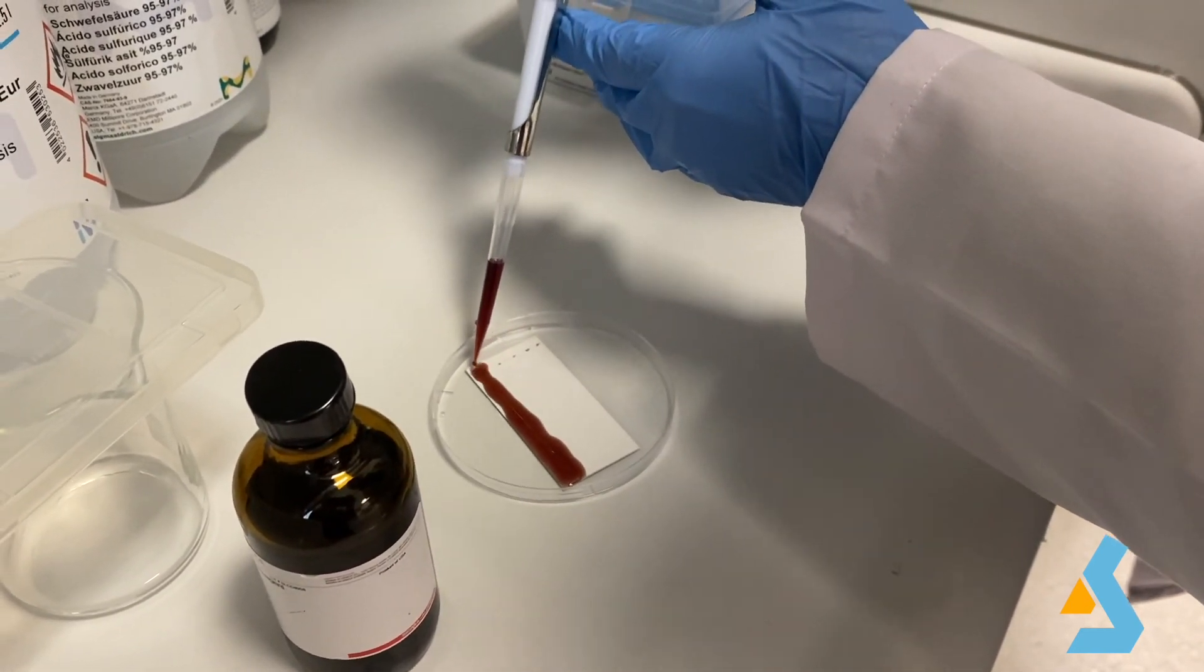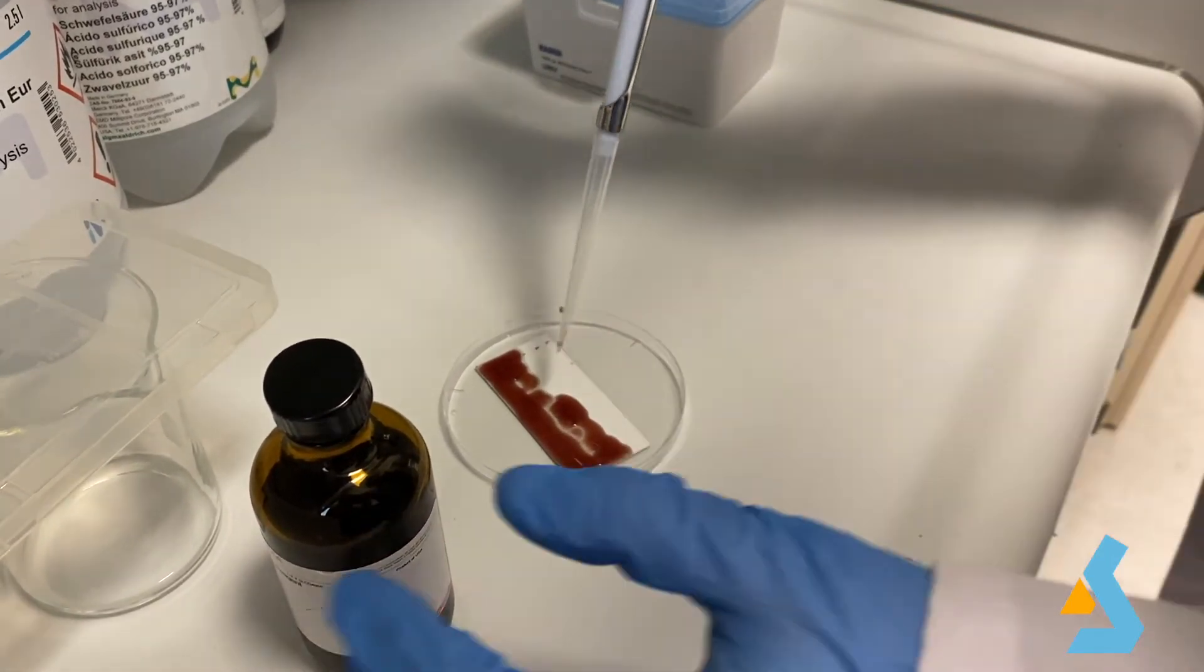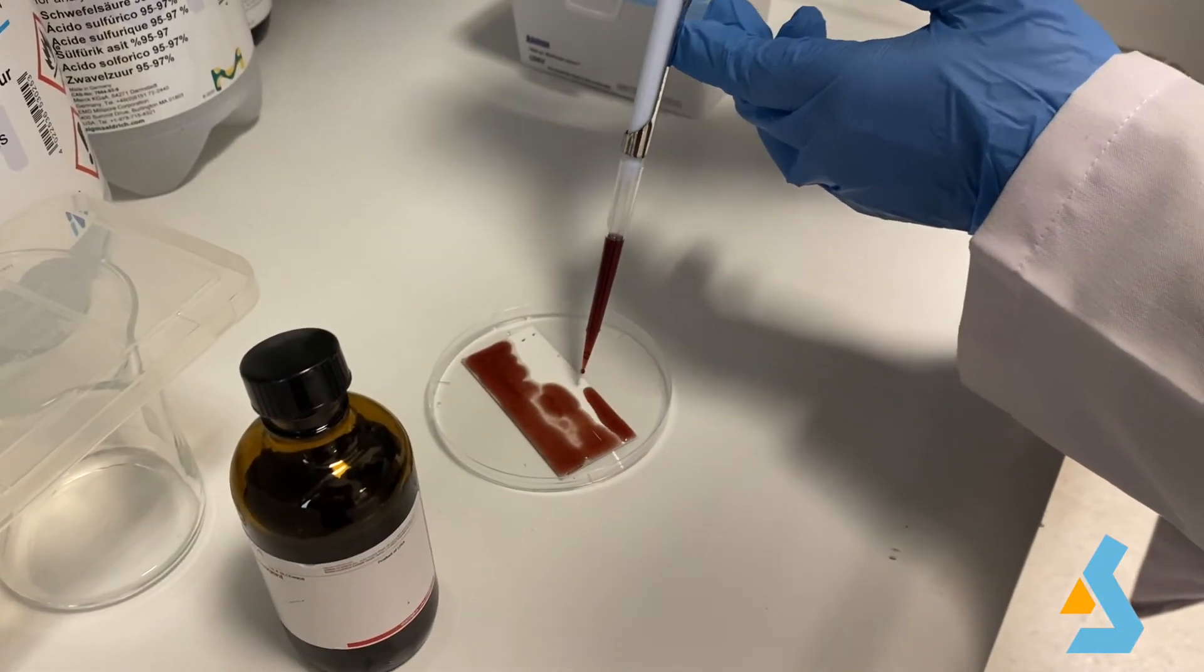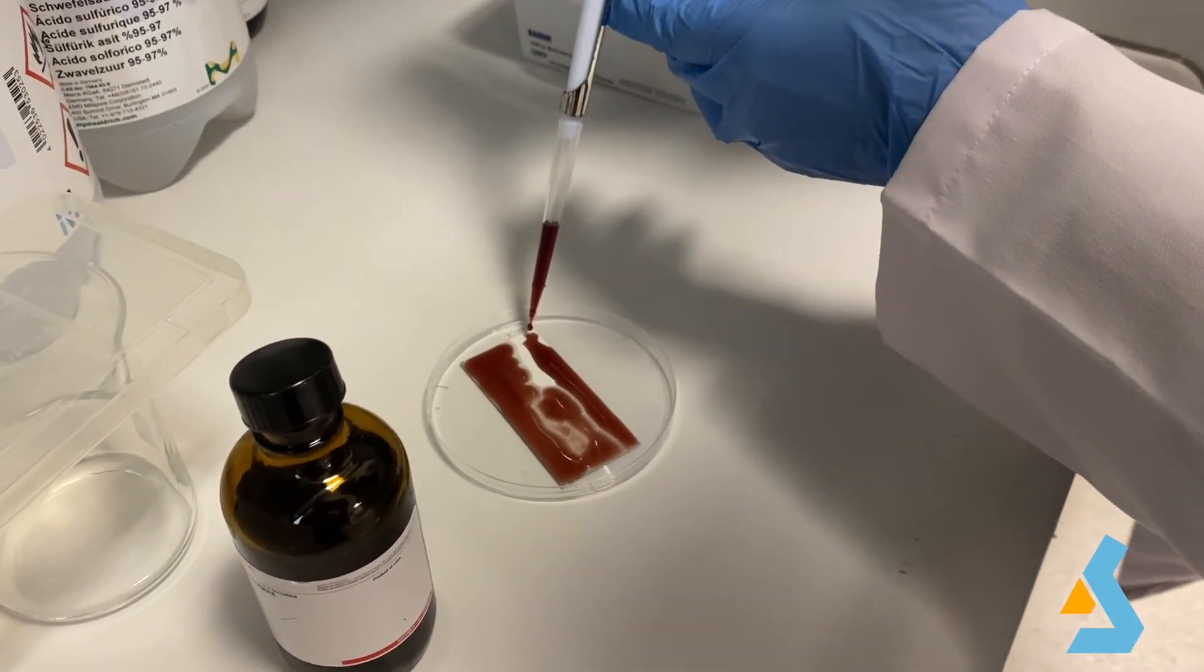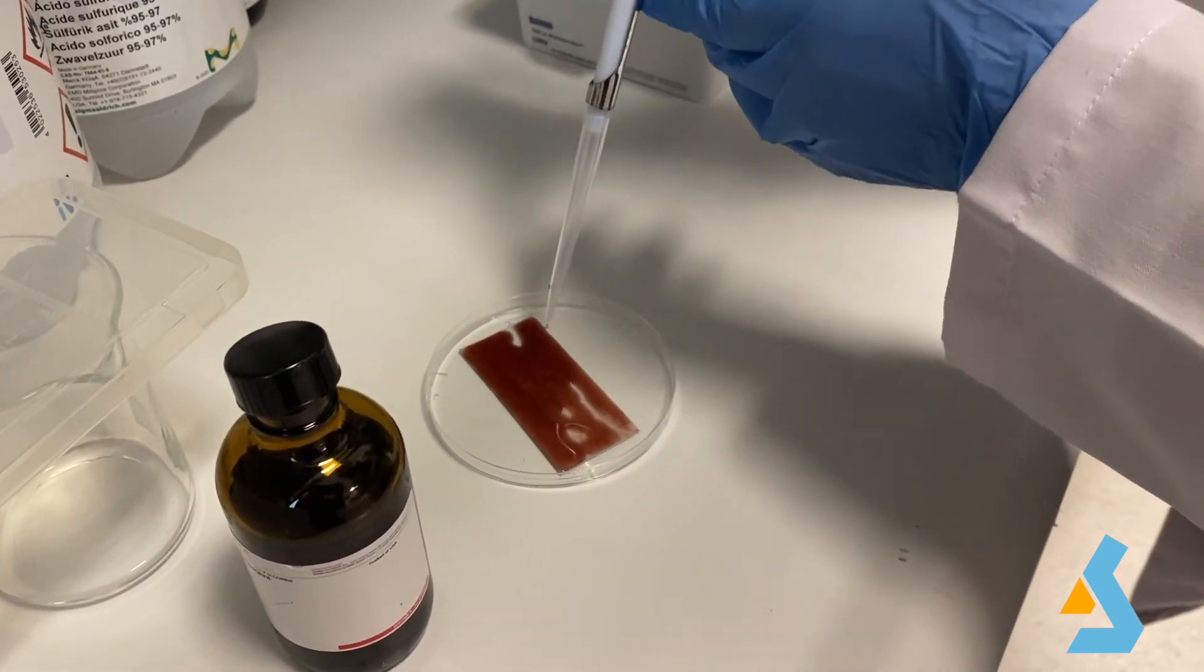Ninhydrin is applied with the help of a micropipette. However, a better way to apply ninhydrin could be with the help of a spray.